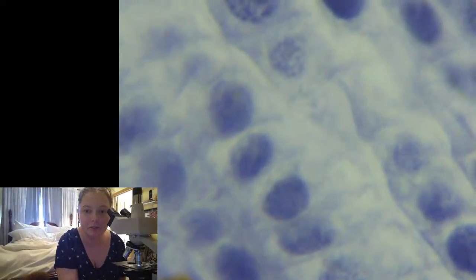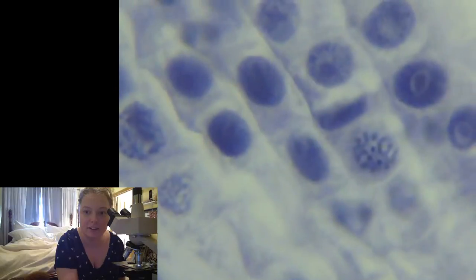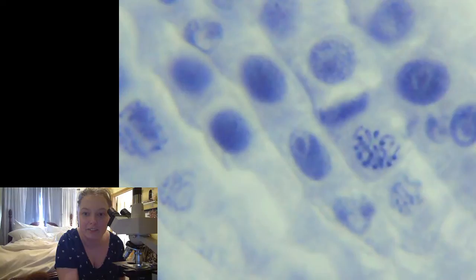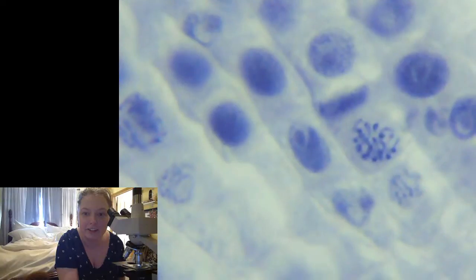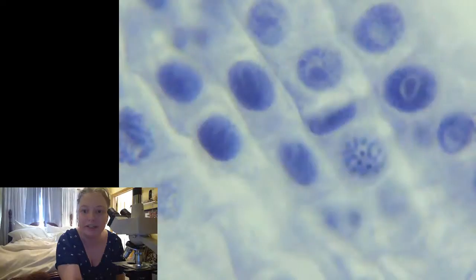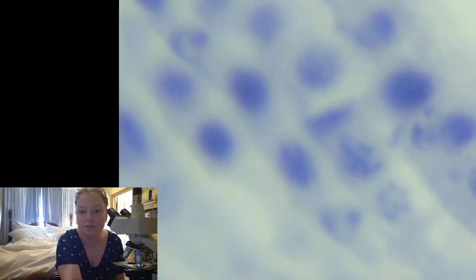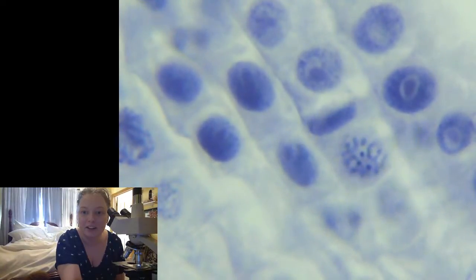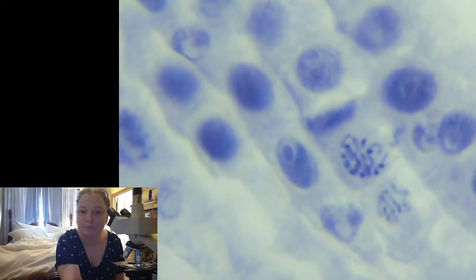It's hard. Your viewing screen is not as... There, that one is kind of neat. Kind of to the right of the screen. And what's cool too is they're 3D, so you can zoom kind of through the cell a little bit. You know, this is kind of the top, and then through the middle, and then through the bottom.